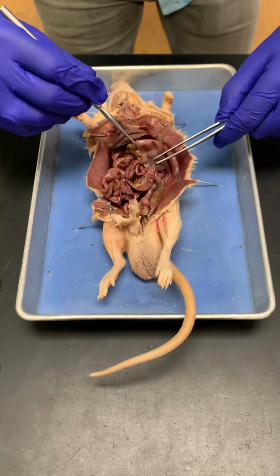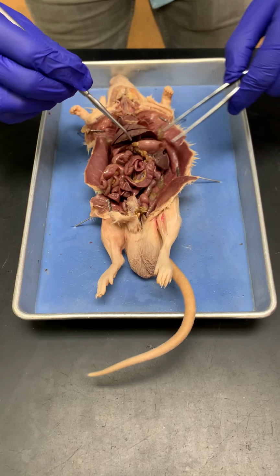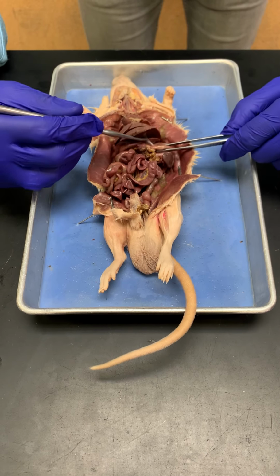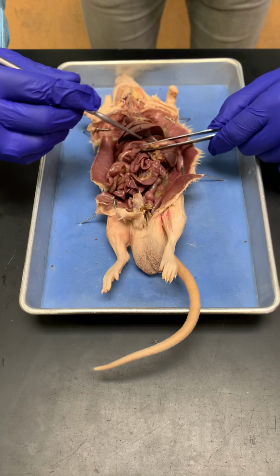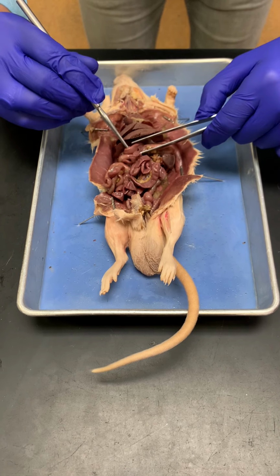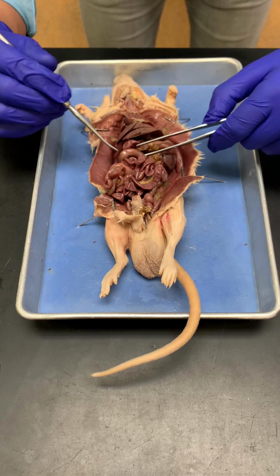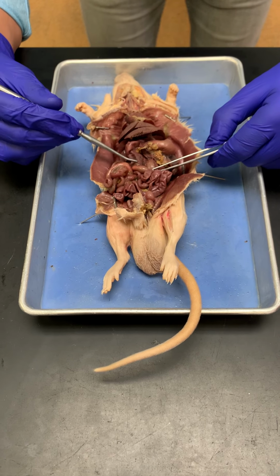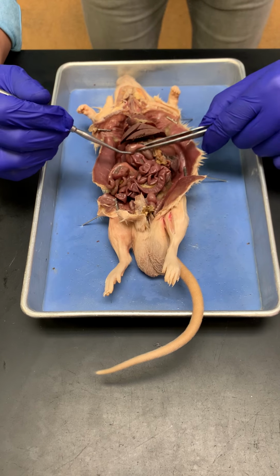And then this part here, this is the spleen. So you can see the spleen. And then you have small intestines and large intestines. So here towards the terminal end of the stomach, this is where the small intestine starts. So that's right here. So it goes here, goes all the way down. This structure here on the inside, see that right there? That is the pancreas. So that's the pancreas.